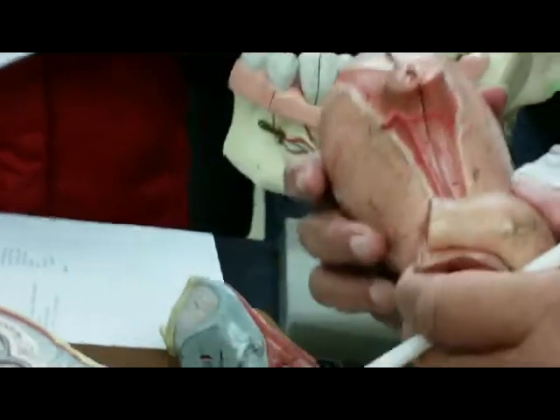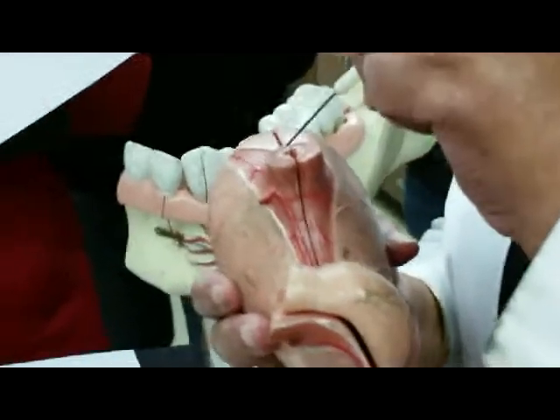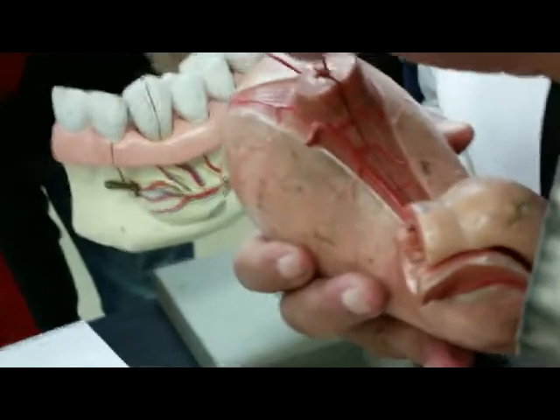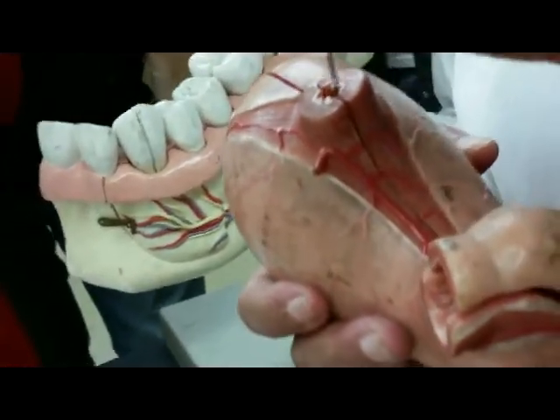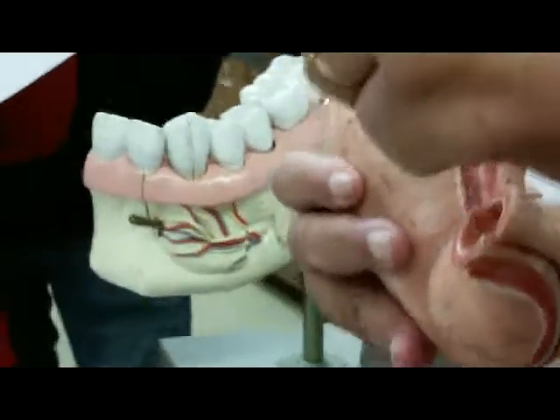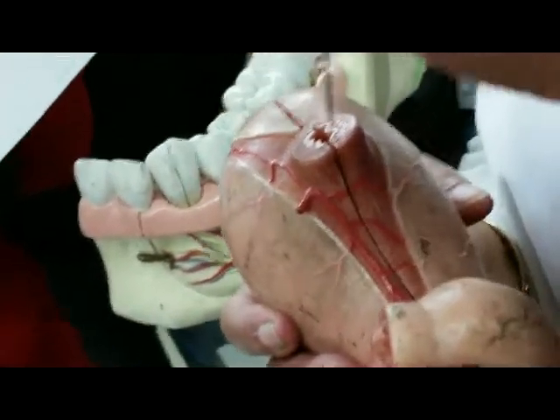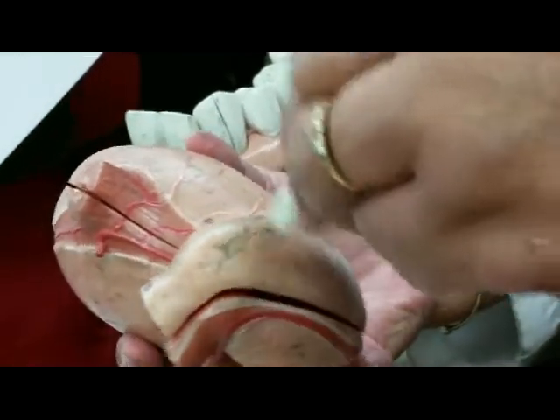So we have 2 rings of muscles. So here, since it's a cardiac region, this ring of muscles would be the cardiac sphincter. Sphincter means a ring of muscles. The cardiac sphincter is right there. Since this is the pylorus, this would be the pyloric sphincter. So to repeat, cardiac sphincter, fundus, body, pylorus, pyloric sphincter.